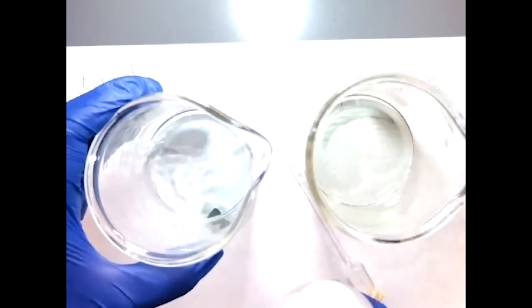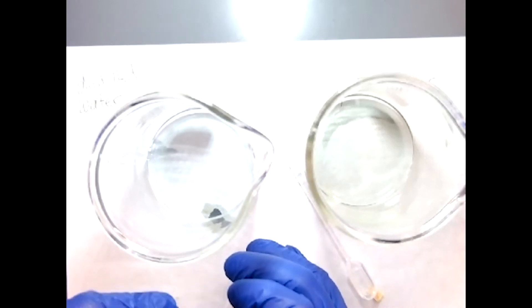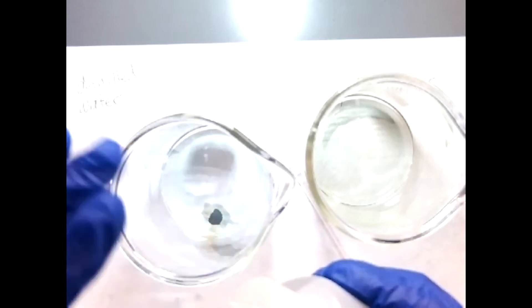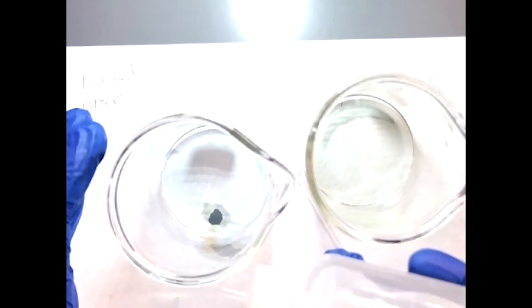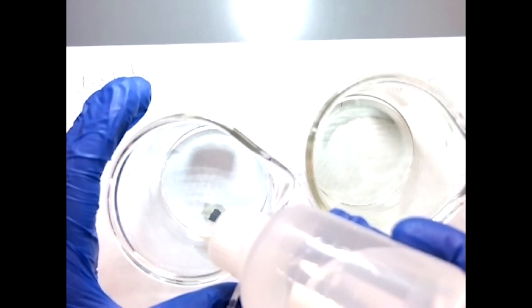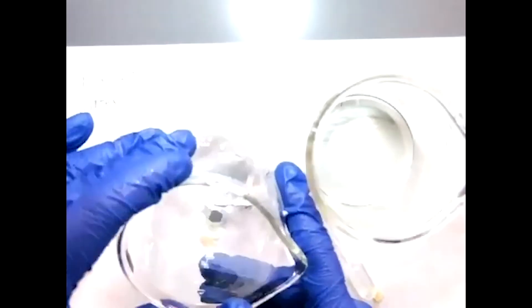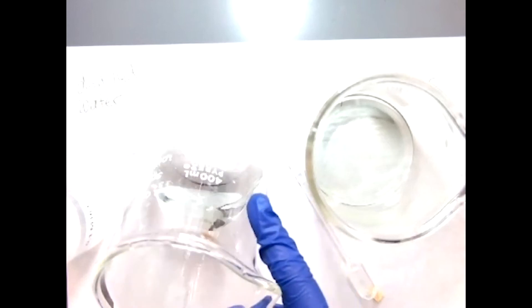One drop. That's a second drop. That is definitely no longer blue anymore, so that took two drops.